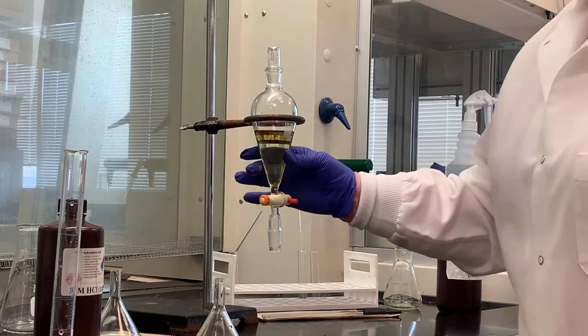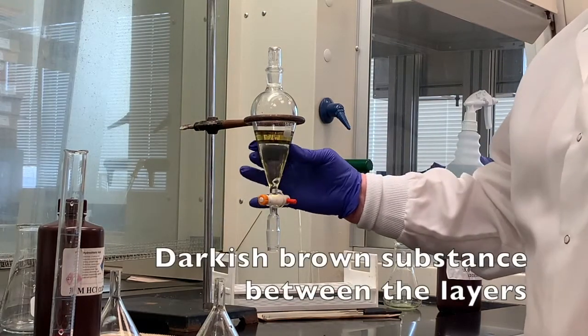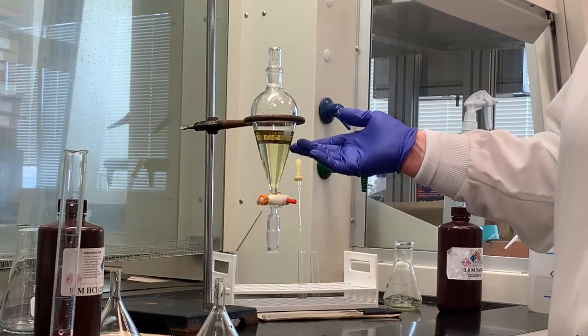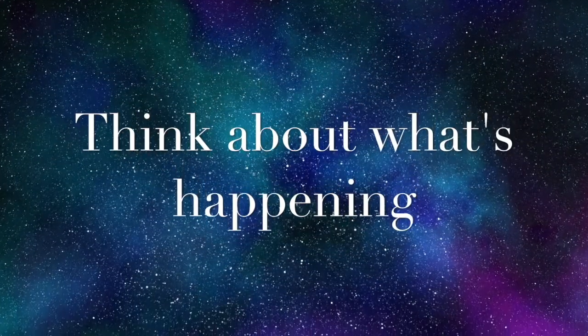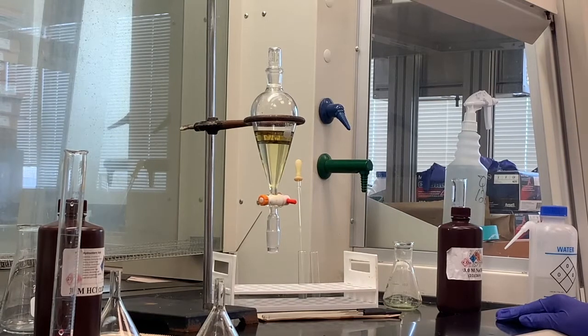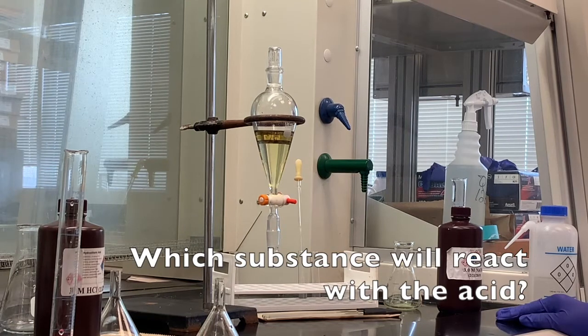There still seems to be some of that, almost looks like a mucus type substance, in between where the organic layer and the aqueous acid layer is. Now let's think about what's happened here. If I add acid to the organic solution that had the benzoic acid, the p-nitroaniline, and the naphthalene dissolved in it: naphthalene isn't going to react with the acid because it's a neutral compound. The benzoic acid will not react with the acid because it is an acid, and acids don't react with acids. Acids only want to react with bases.